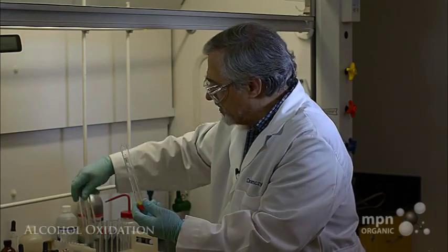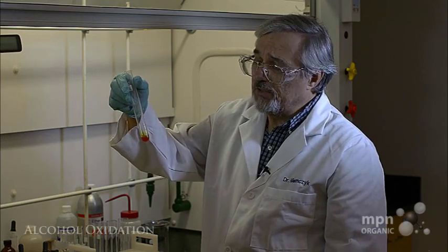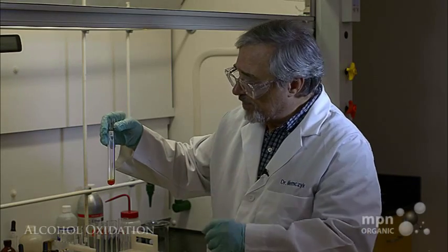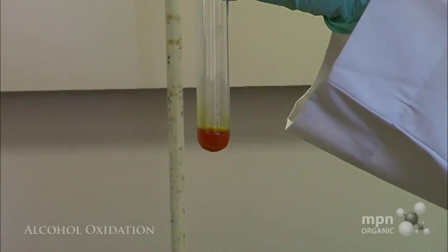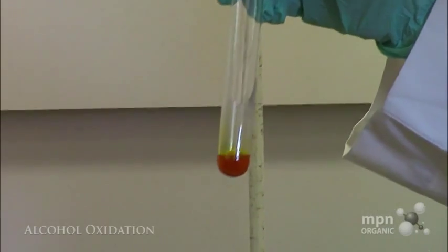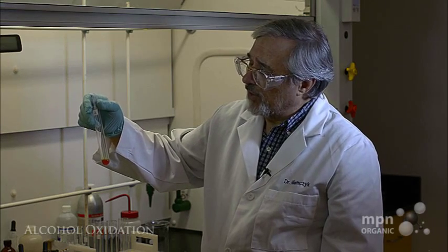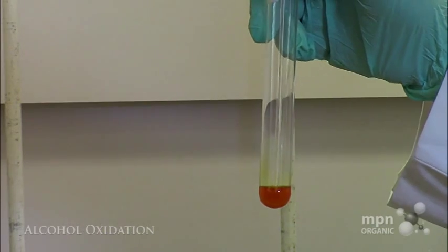Now, if you let this test tube stand overnight, it eventually will react, but in a short space of time, we've been able to distinguish between the primary and secondary as a group and the tertiary alcohol as a group. So this particular test is really very convenient for those people who are trying to distinguish between those two classes of alcohols, primary and secondary on one hand, and then the tertiary alcohol on the other hand.